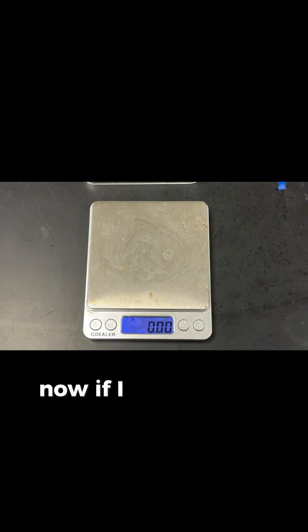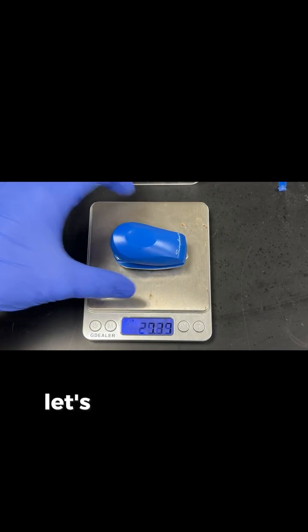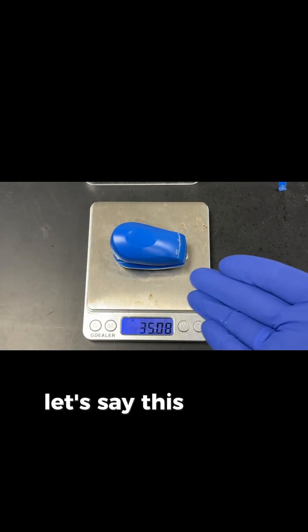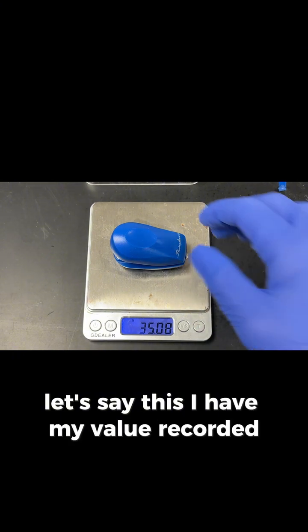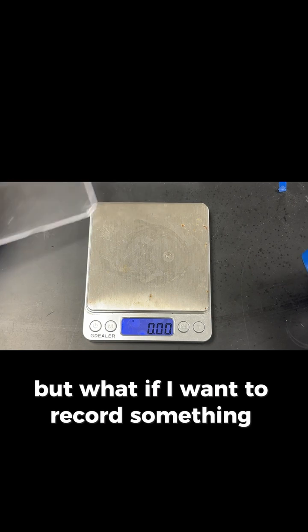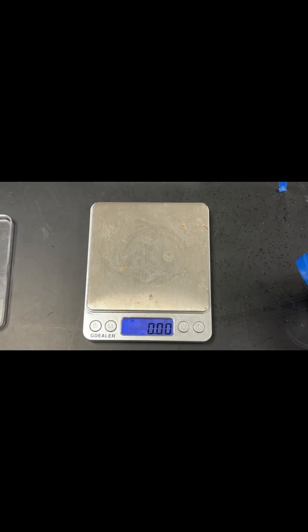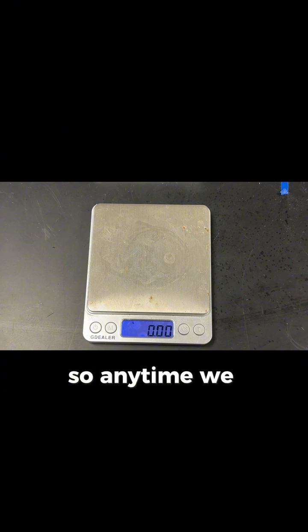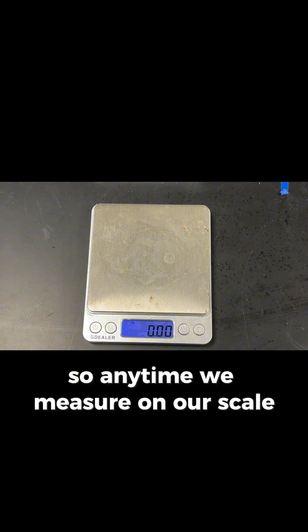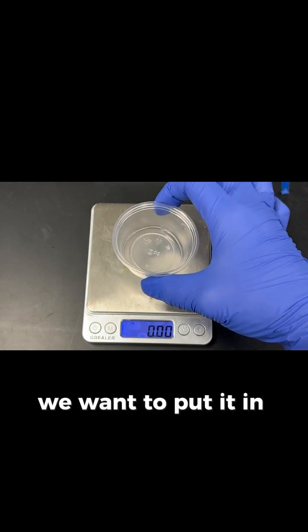Now, if I were to put something on my scale, let's say this, I have my value recorded. But what if I want to record something that is in a container? So anytime we measure on our scale pieces of anything or chemicals, we want to put it in a cup.